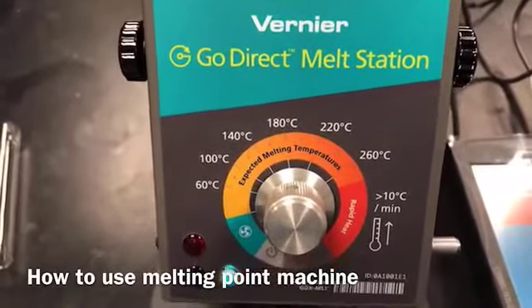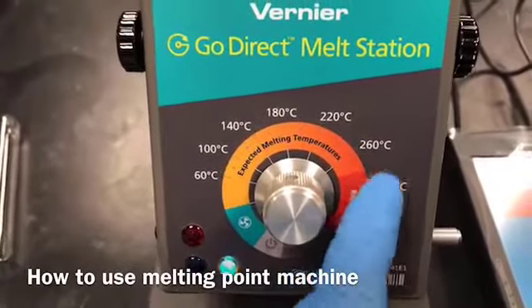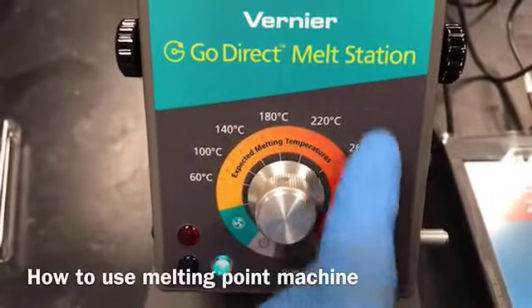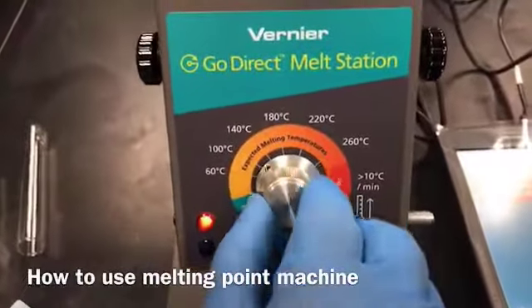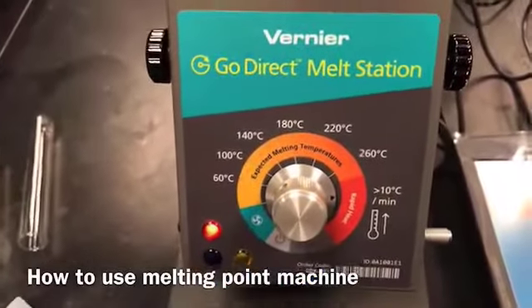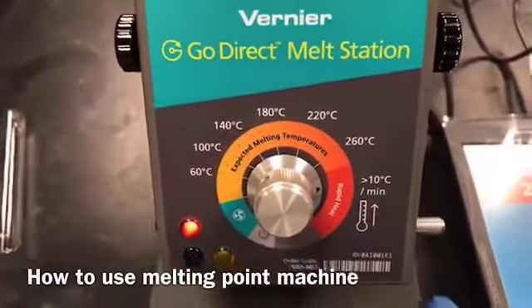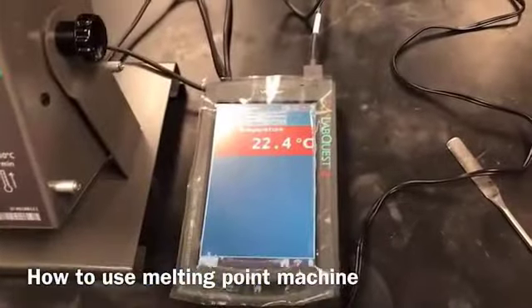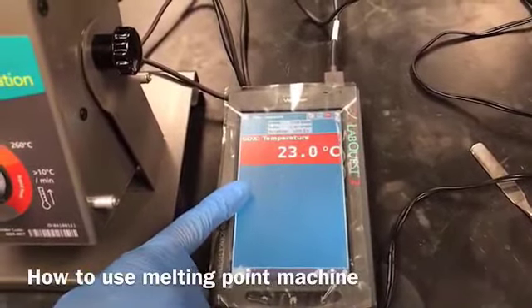So I need to heat my machine in order to melt the sample. As you can see, this is the rapid heat section, and it would heat the machine at more than 10 degrees centigrade per minute. So I'm going to turn it to this side, right? Now this is the data recorder. This is the LabQuest. This is an interface, and that's the data recorder. As you can see, the temperature is rising here very fast.